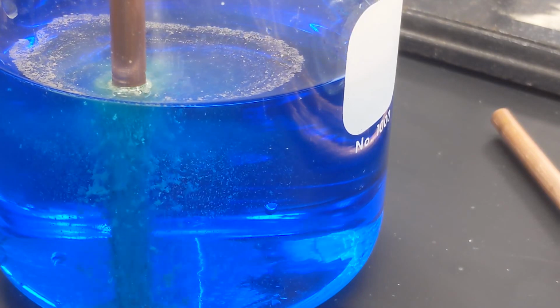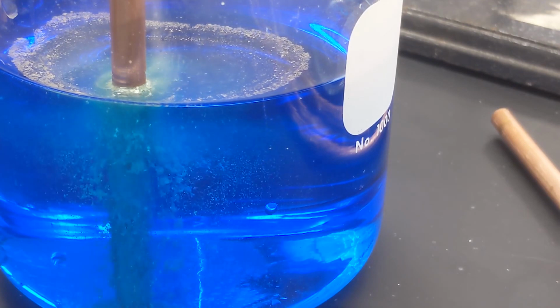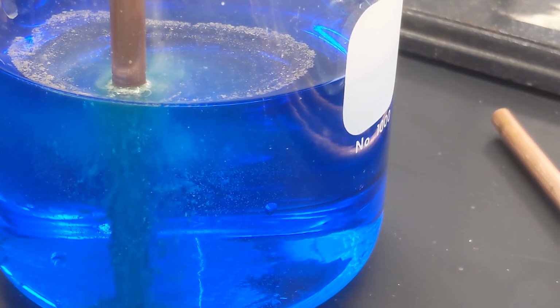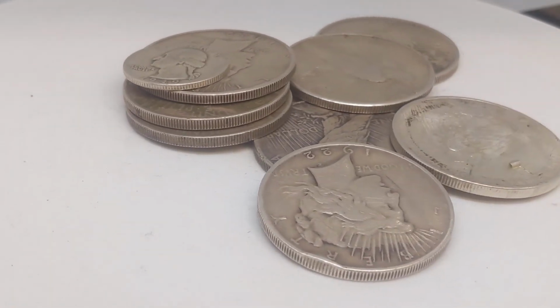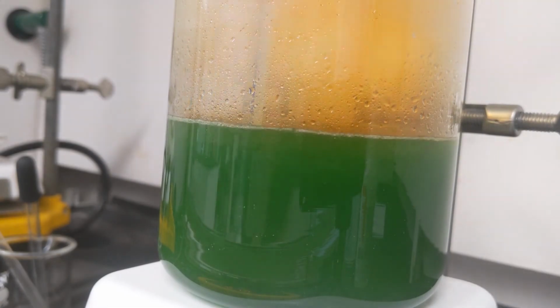And the answer to the first thing is, well, I did this at scale, and that is where you need to be doing everything correctly, because if you don't, when you're doing it at scale, you're going to have a bad time. I didn't have one quarter, I had many, many dollars. And when you're dealing with a few hundred grams of material, you better know what you're doing, which I didn't.